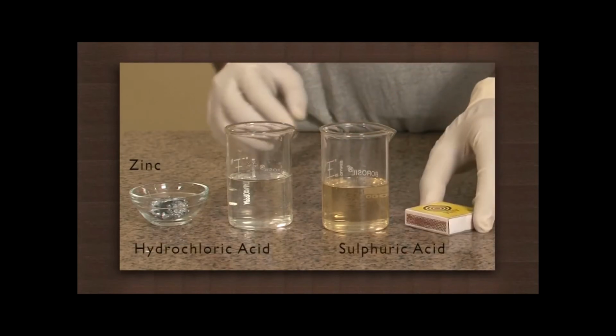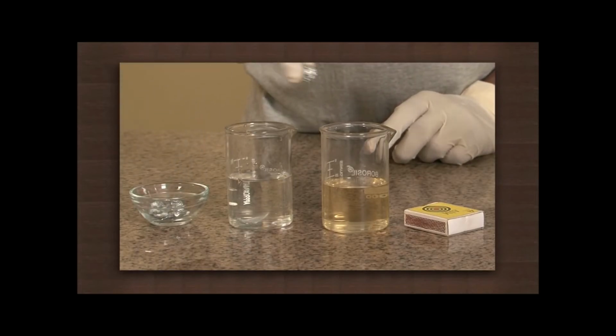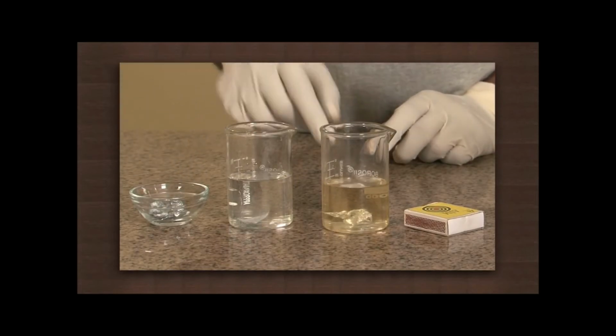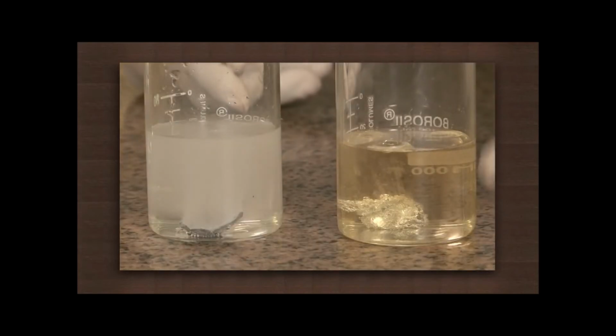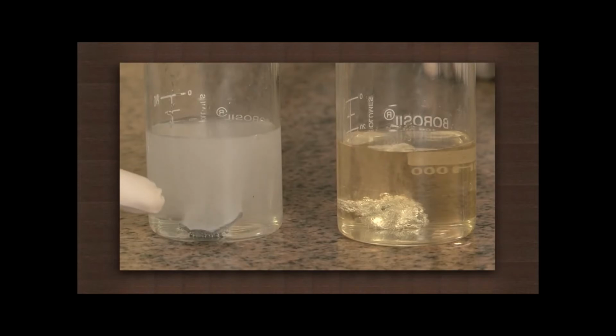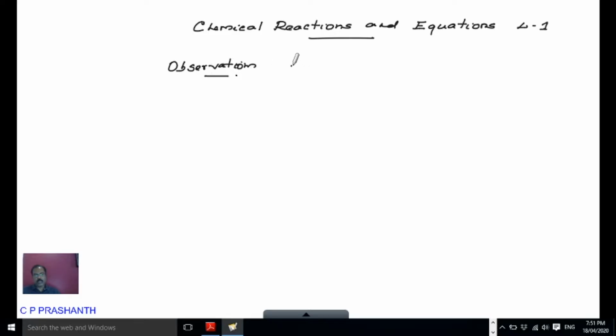We have a little zinc. In one test tube we have hydrochloric acid. In one beaker we have hydrochloric acid, and second we have sulfuric acid. We put zinc in both of them and see what happens. You can see in both these beakers some gas is evolving, and you know very well it is hydrogen gas. Now let us understand these observations. Let us discuss these observations in detail.